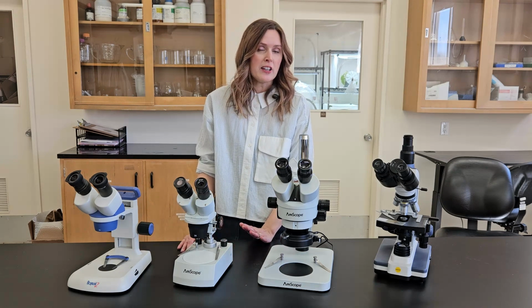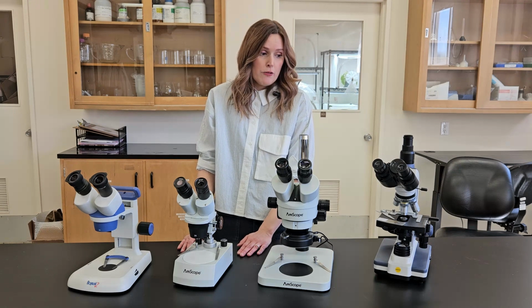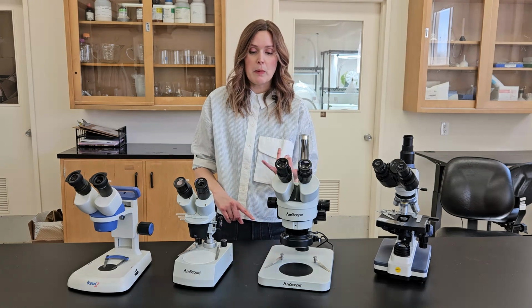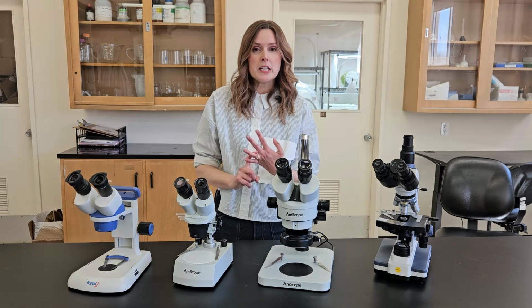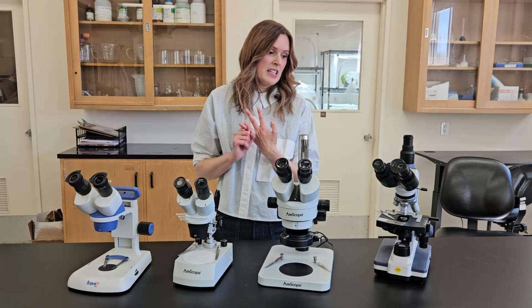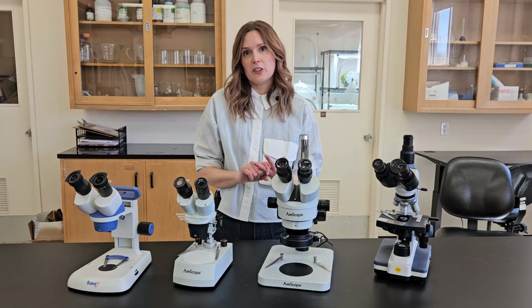Either way, I think investing in a microscope is a critical part of running a greenhouse farm these days in terms of both identifying pests, because we're getting a lot more invasive pests than we used to, and quality controlling your biocontrol agents, and even just looking at diseases or nutrient deficiencies under the microscope.